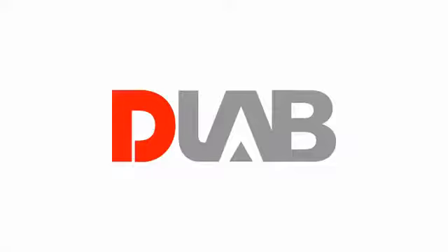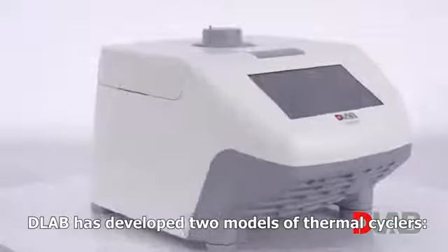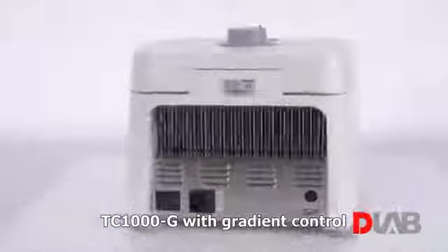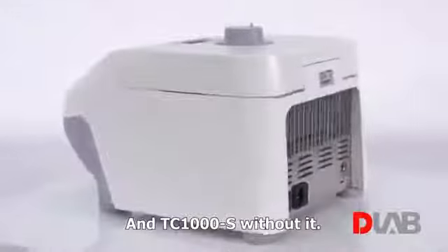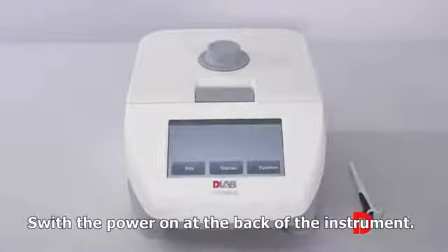PCR thermal cycler. DLAB has developed two models of thermal cyclers, TC1000G with gradient control, and TC1000S without it. Switch the power on at the back of the instrument.